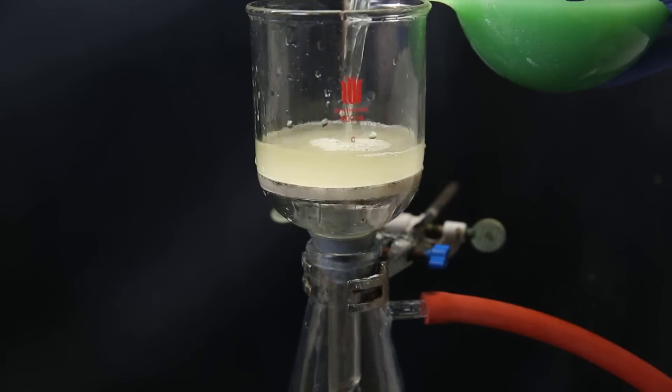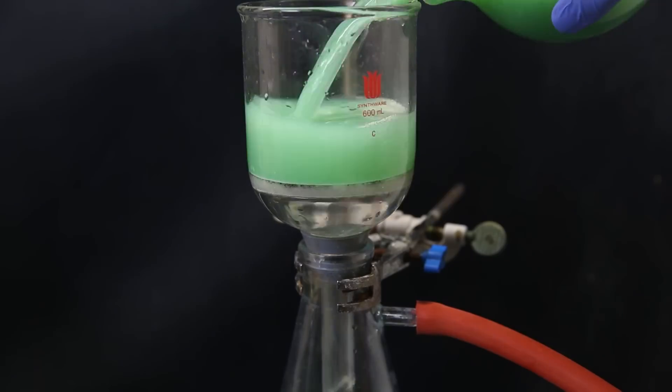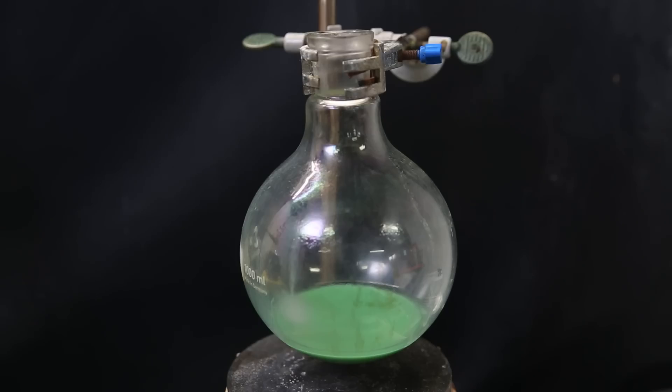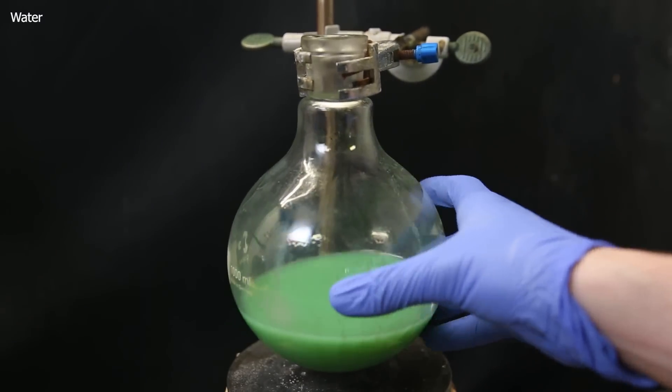When that was done, I tried to filter out the solid, but the particle size was very small and it passed through the filter. Instead, like before, I just left it all to settle and decanted off the majority of the liquid. I then wash it with water a few more times and repeat the process.